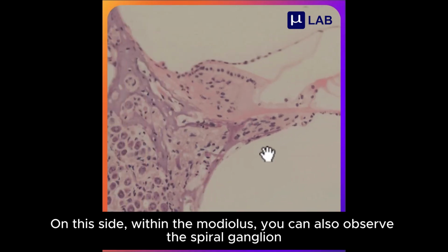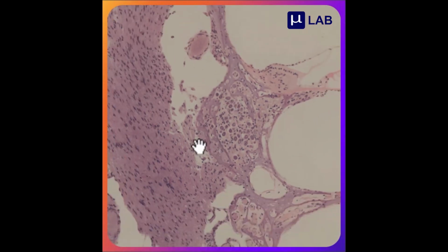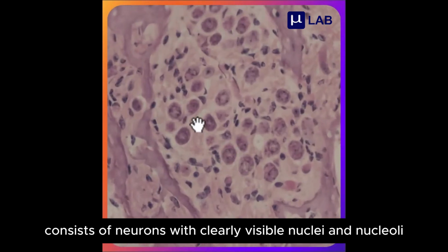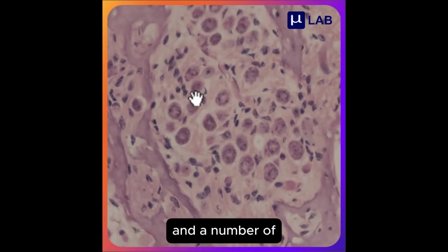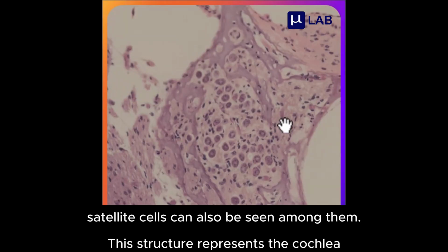On this side, within the modiolus, you can also observe the spiral ganglion. The spiral ganglion consists of neurons with clearly visible nuclei and nucleoli, and a number of satellite cells can also be seen among them. This structure represents the cochlea.